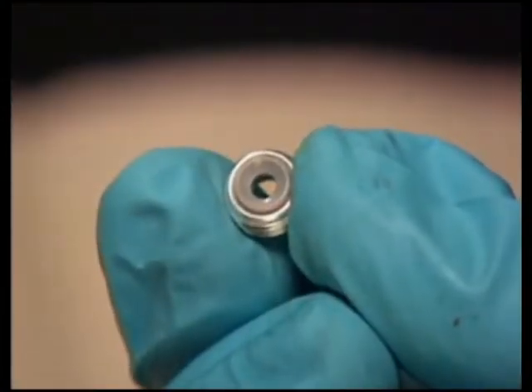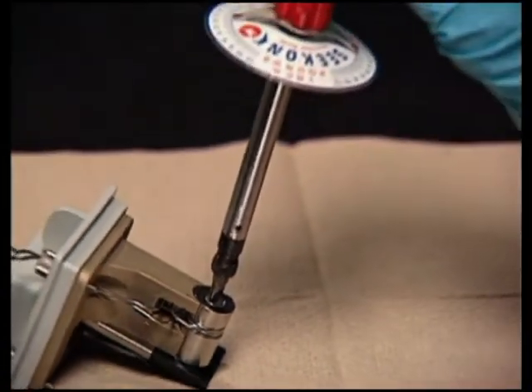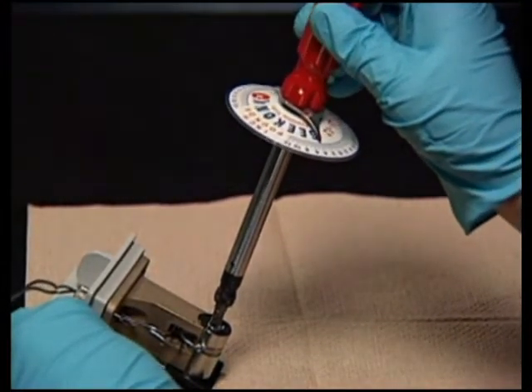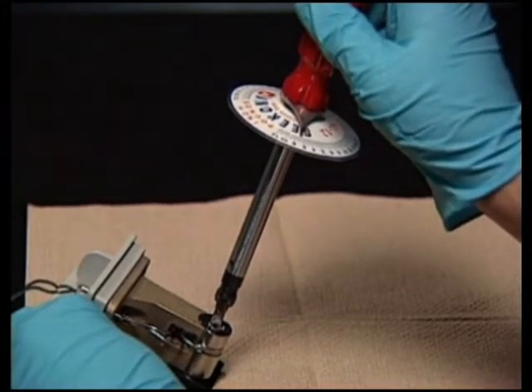With the tan colored side of the lens screw facing down, use a torque wrench to tighten the entrance lens screw into the flow cell body to 128 inch ounces or 8 inch pounds. This will ensure that the entrance lens does not crack due to over-tightening and a leak does not form due to under-tightening.